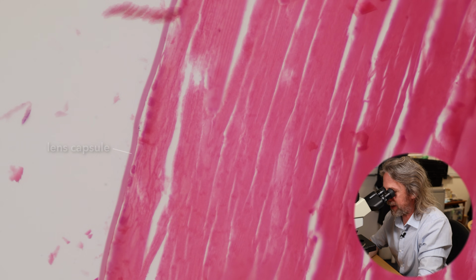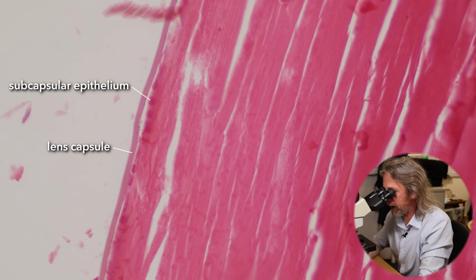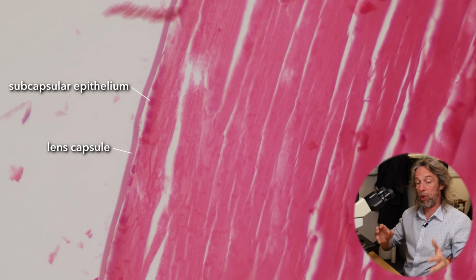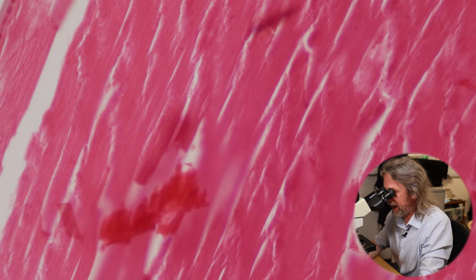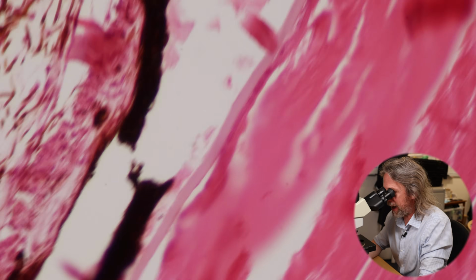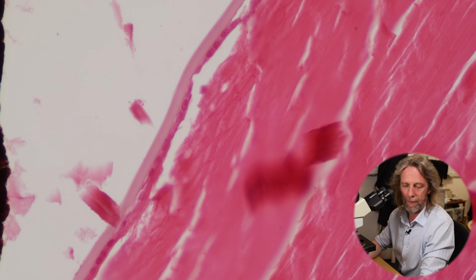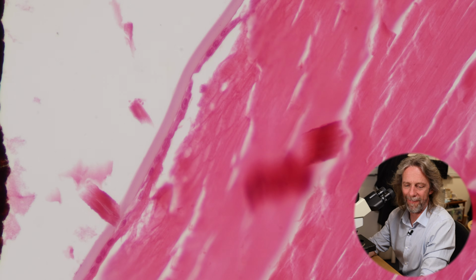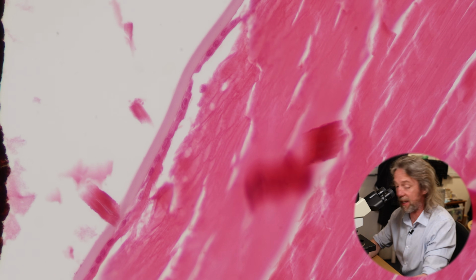So we've got the capsule, this thick basement membrane, and then you've got a layer of cells. We can see their nuclei up against it. So this is a simple cuboidal epithelium. So the subcapsular layer. And there we go. You can see that capsule, and you can see that subcapsular layer, that subcapsular epithelium.